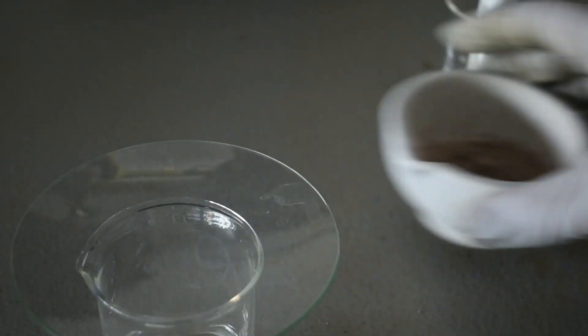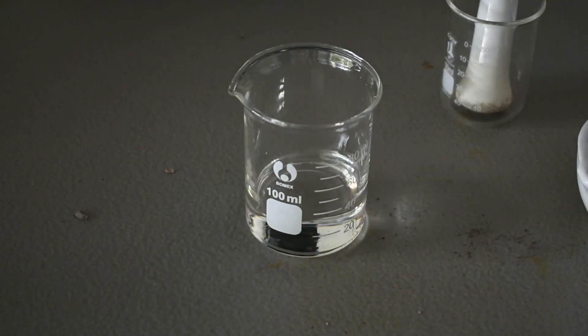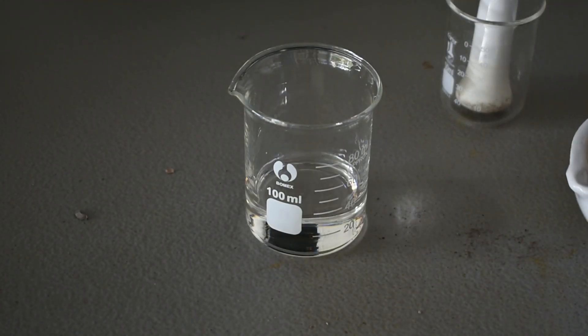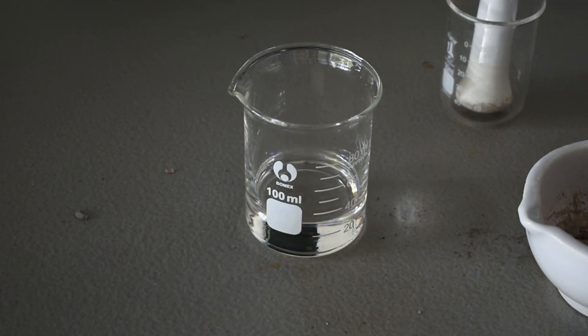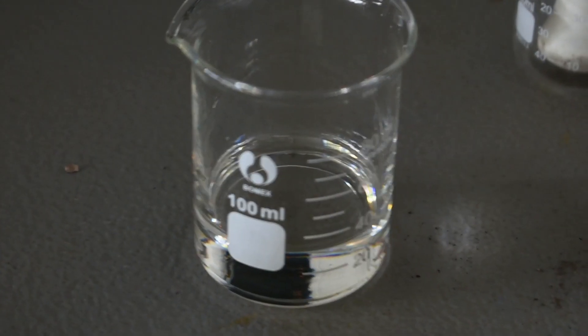I'm going to get my pyridine right here. Let's get that in view of the camera. And I'm just going to add a couple chunks at a time. We should see a yellow color, actually. Let me zoom in so that you can see.